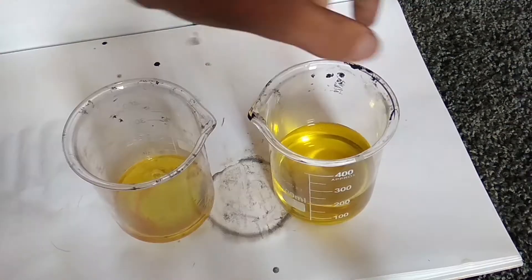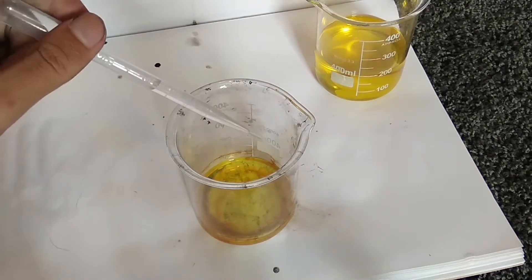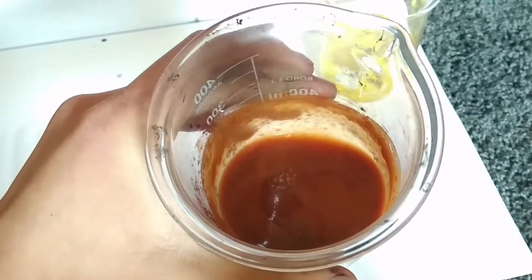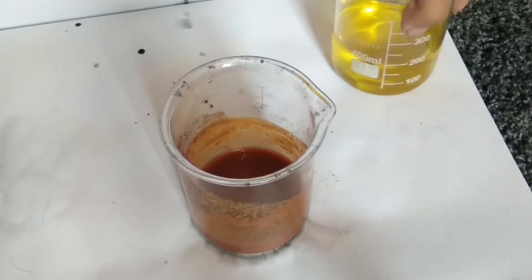To fix this, just pour off one third of the solution and add enough sodium hydroxide to neutralize it. At this point we'll see a brownish solid forming along with some white specks — this would just be iron hydroxide and zinc hydroxide.